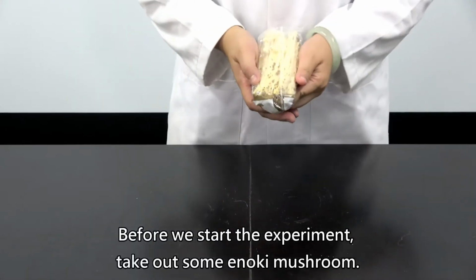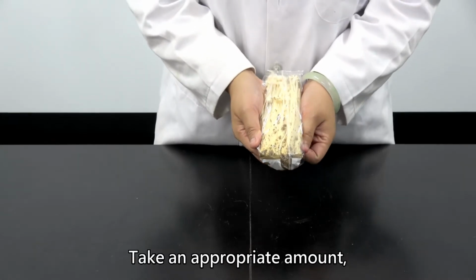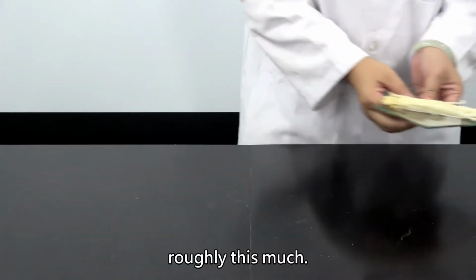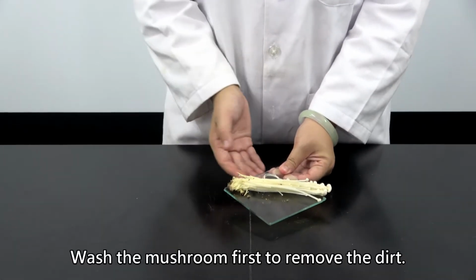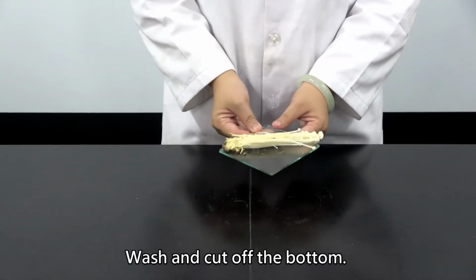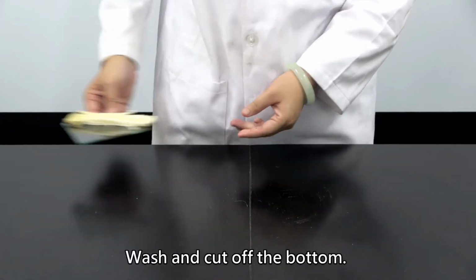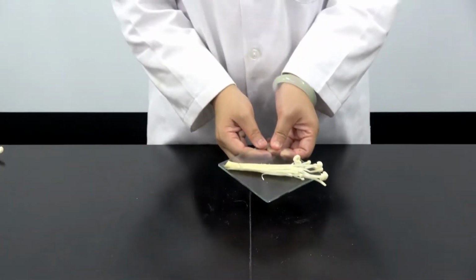Before we start the experiment, take out some enoki mushroom. Take an appropriate amount, roughly this much. Wash the mushroom first to remove the dirt. Wash and cut off the bottom. It will be like this after we cut it off.